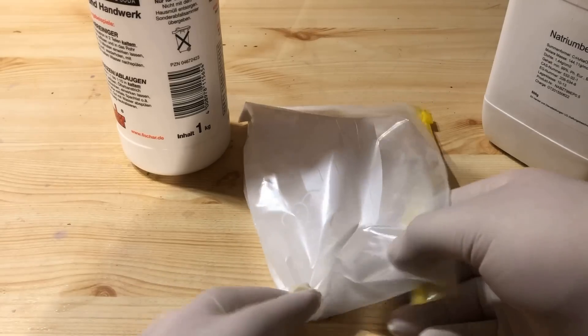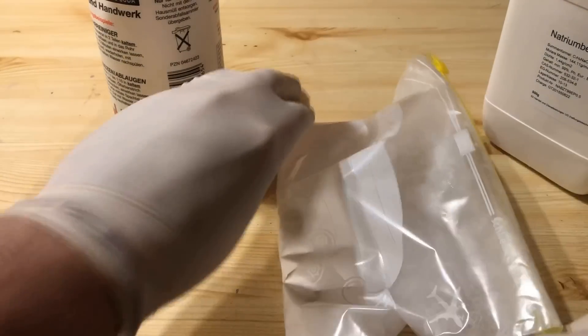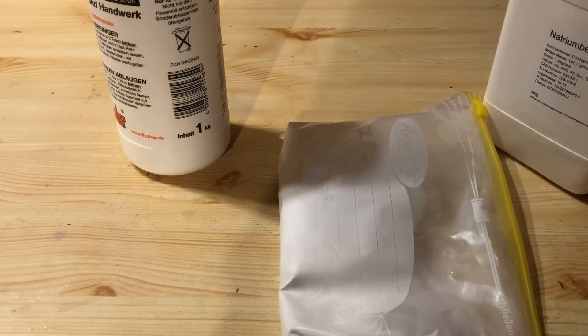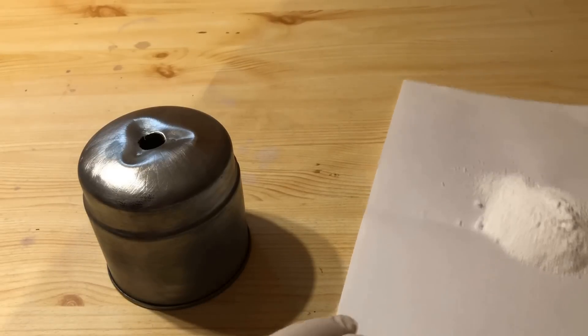In a 1-liter Ziploc bag, I mixed 100 grams of sodium benzoate and 60 grams of sodium hydroxide. Both substances I have previously finely ground in a mortar.